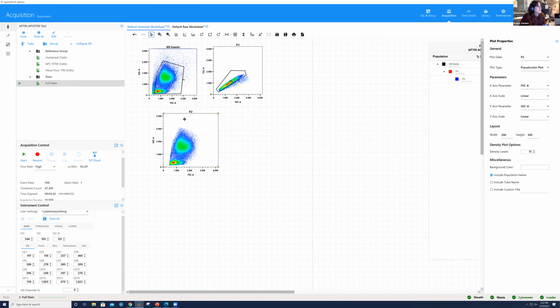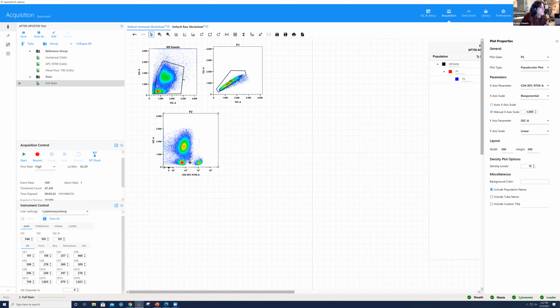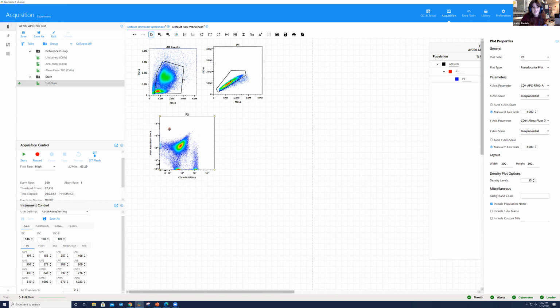And if I double click here, let's look now to see what it looks like for a combination that has a much higher similarity. So here we'll look at APCR 700 for our CD4. And here we're going to look at our CD14. So it's already looking a bit different. It doesn't look as clean, but I also want to take into account the fact that my scaling is not great here. If you're looking at the plot properties on the right, we're on manual scaling for biexponential, and you do have the capability to make changes here. So if I change this to negative 7,500 as opposed to negative 1,000, that looks much different, okay? I can do the same here, or alternatively, I can change it to auto scaling, right? So you can do either auto scaling or manual scaling when you're looking at biexponential in the software.